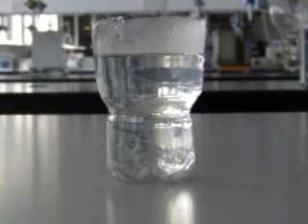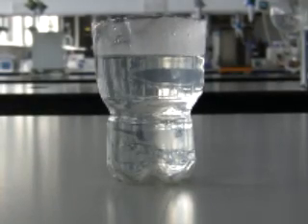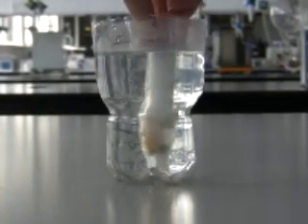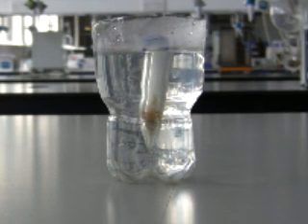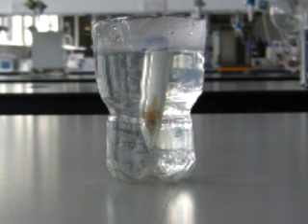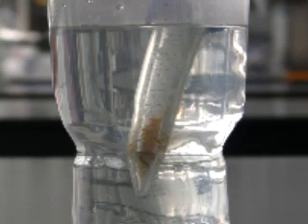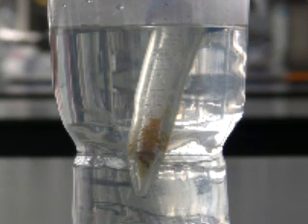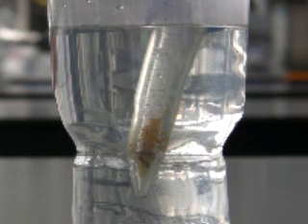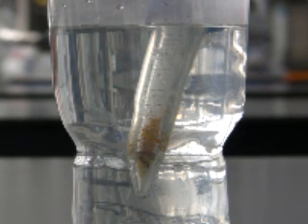The tube is packed with crushed dry ice, or solid carbon dioxide, and then placed into water at 50 degrees. As you may be aware, carbon dioxide normally sublimes, which means it turns directly from a solid into a gas.